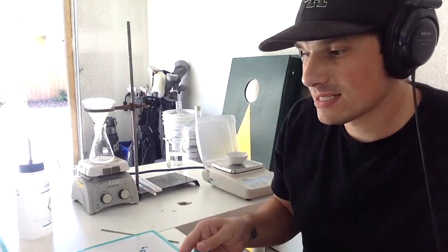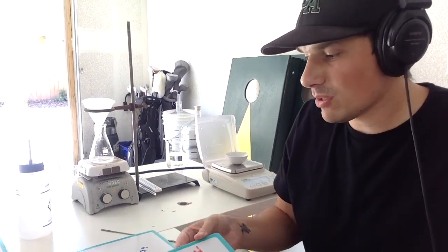So theoretical yield is based off of the 0.53 grams of salicylic acid that we put into the reaction. How many grams of acetylsalicylic acid should we theoretically make? And then we only got 0.11 grams. So how much did we actually yield off of that? Was it real bad? When you're doing this organic stuff, you are really looking for a high yield, something in the high 80s, low 90s to mid 90s, something like that. There's always going to be a slight loss, but we're trying to minimize that loss. So it's up to you guys to determine how much we actually made and what's our percent yield. So here's how we're going to do that.